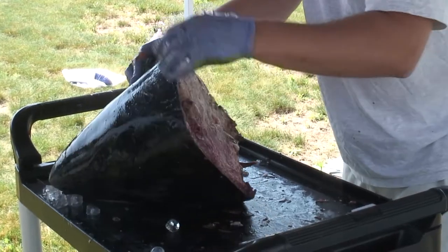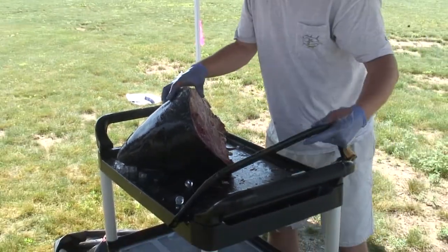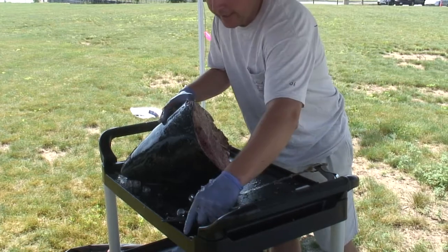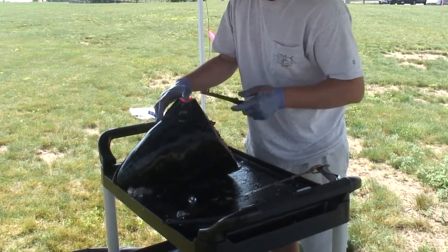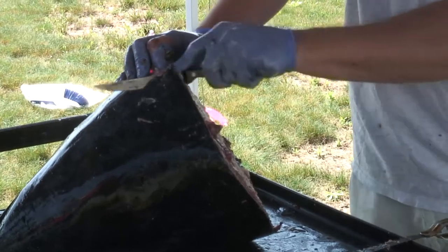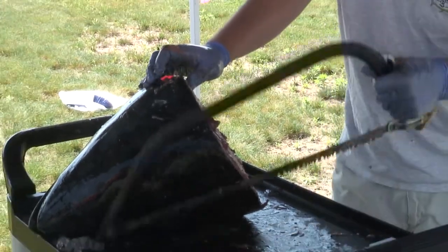What we'll do is we'll make a little cut. To cut through here, you can use any number of things. You can use a sawzall. We have big electric meat saws. Today I'm just going to use a standard wood saw, which works just fine. The easiest thing to do, because the skin around the head is very tough, is to usually make some sort of a primary cut or incision with a knife. This will give you a good starting point — just enough to get the saw in there and get it going.